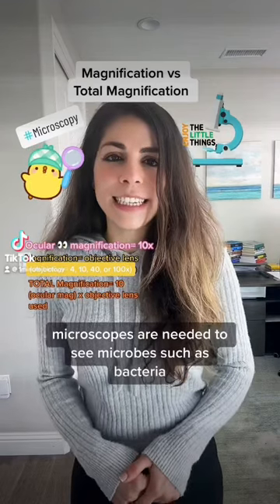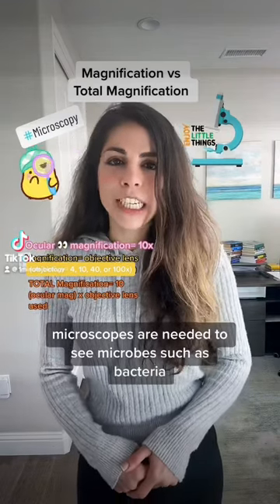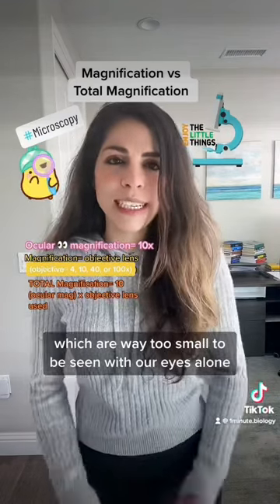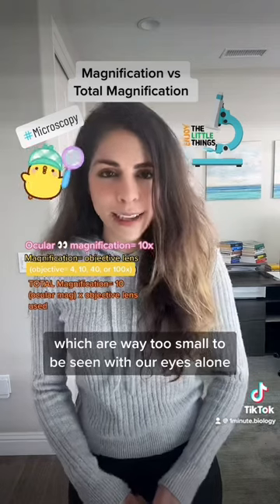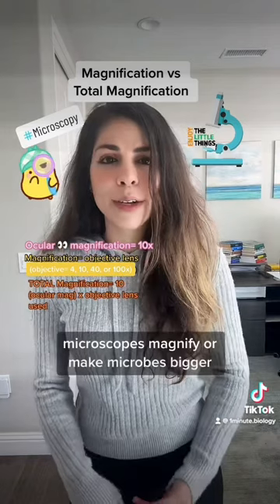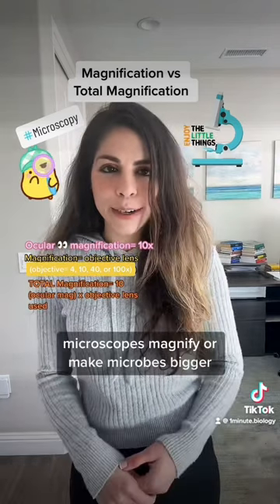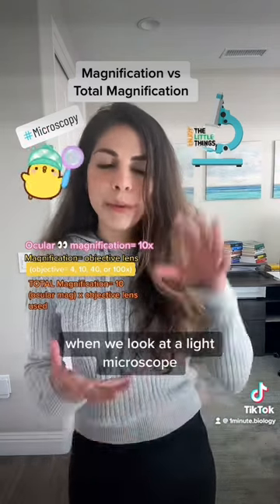Microscopes are needed to see microbes such as bacteria, which are way too small to be seen with our eyes alone. Microscopes magnify, or make microbes bigger.